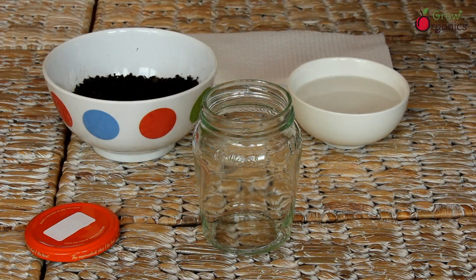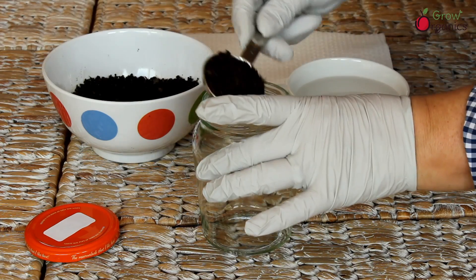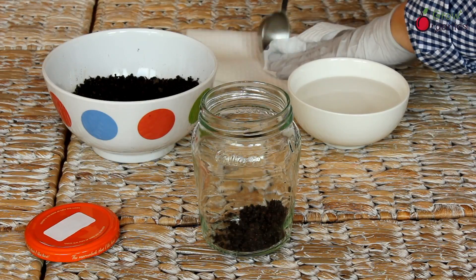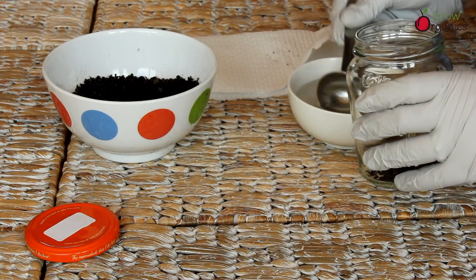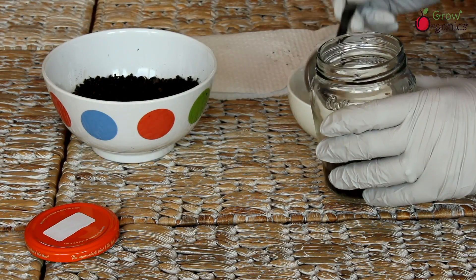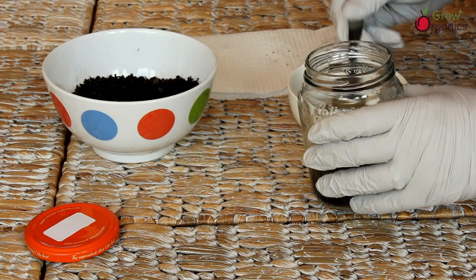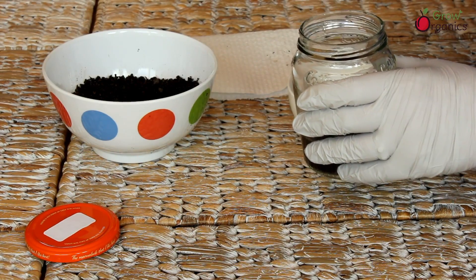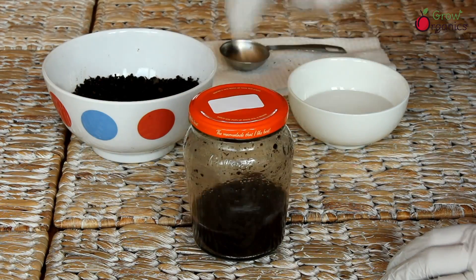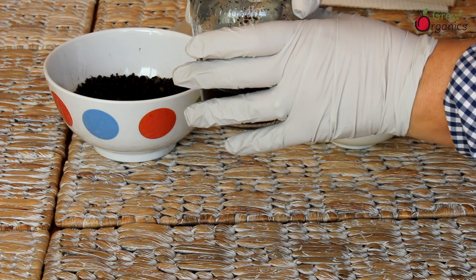There are lots of different pH test kits available. Whichever one you use, check the instructions carefully. Most electronic pH testers, like the one I use, need to be calibrated before use. In an appropriate container I add 5 parts distilled water to 1 part soil sample and shake thoroughly for 5 seconds. Then I wait 30 minutes or so for the contents to completely settle. After a quick swirl, the pH meter goes into the sample.